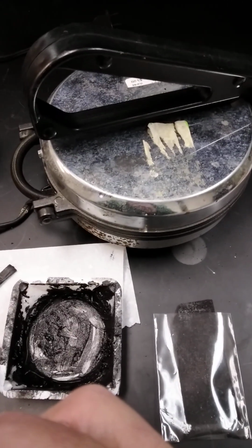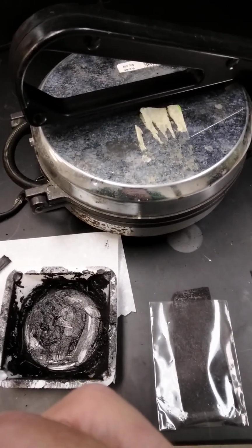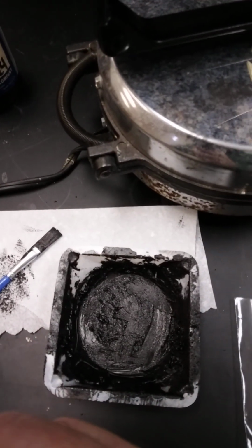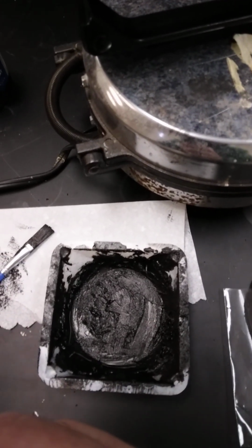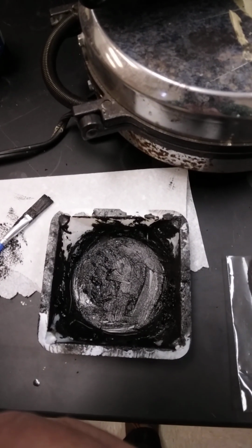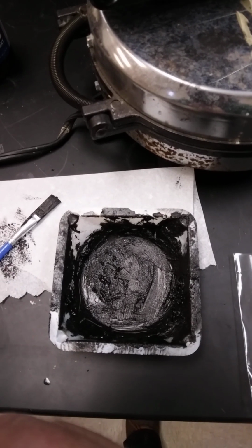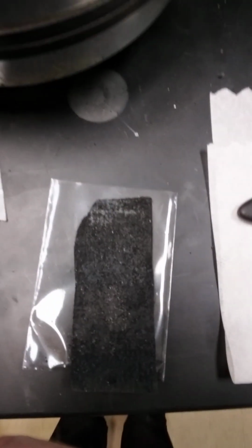Just a short video to show you what we're working on. We're preparing electrodes, and in this short video we'll show you that electrolysis of aqueous sodium hydroxide can be done with the electrodes that we're fashioning. There's one in plastic. And we use a carbon felt pad and then we treat it.